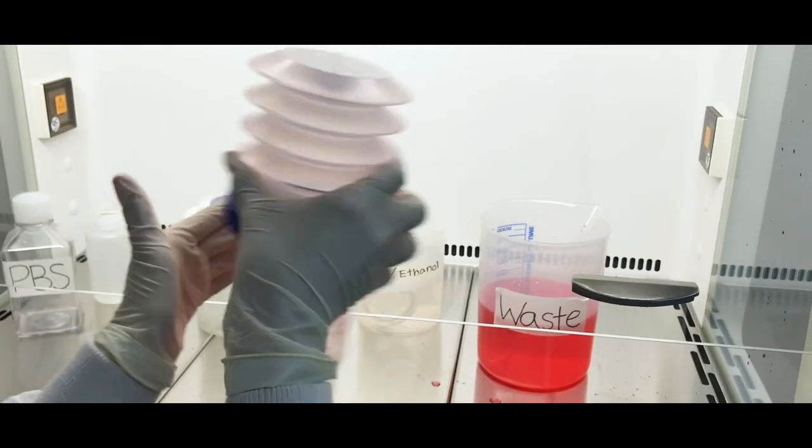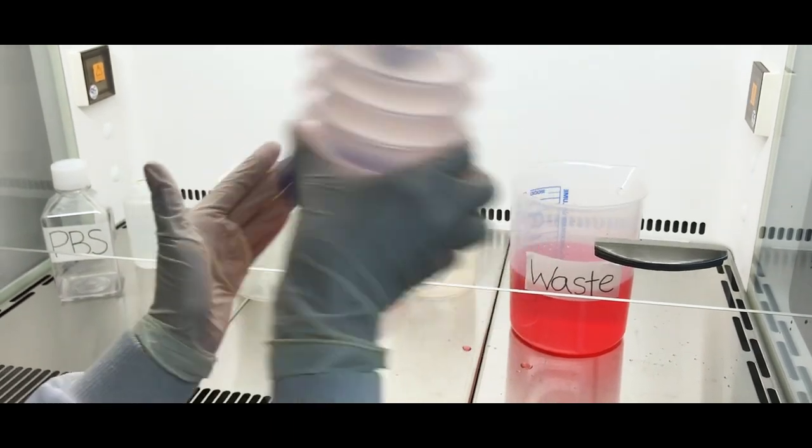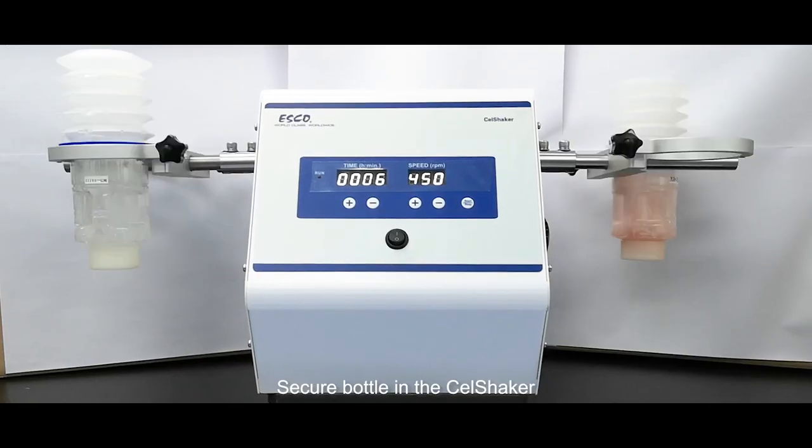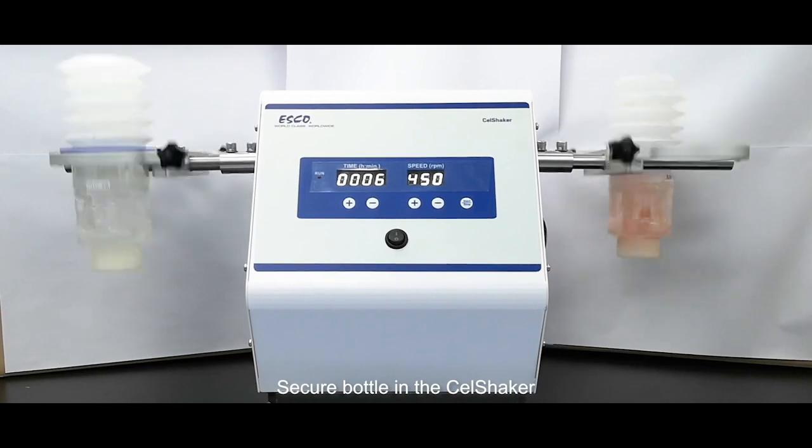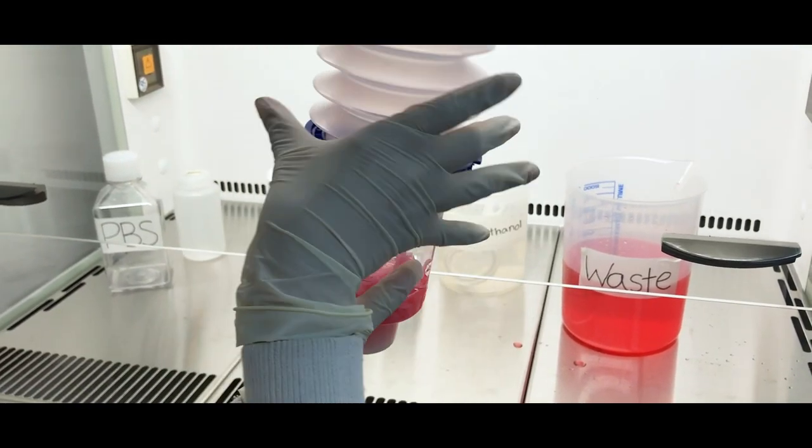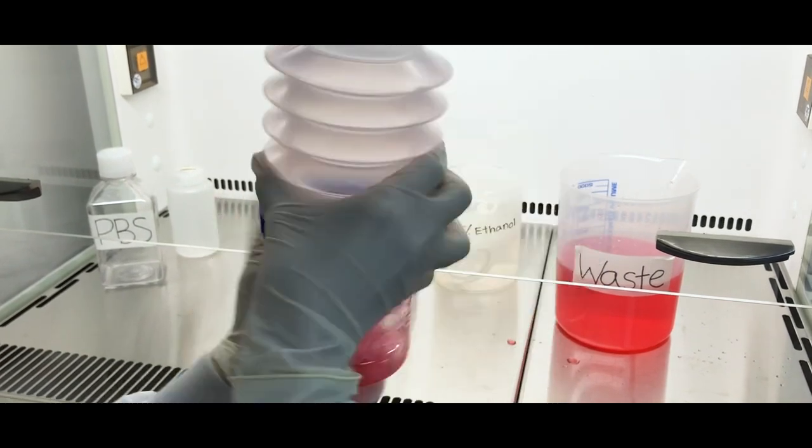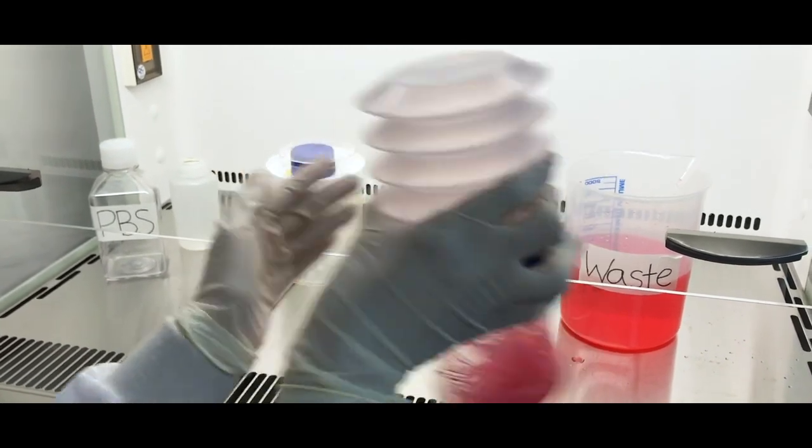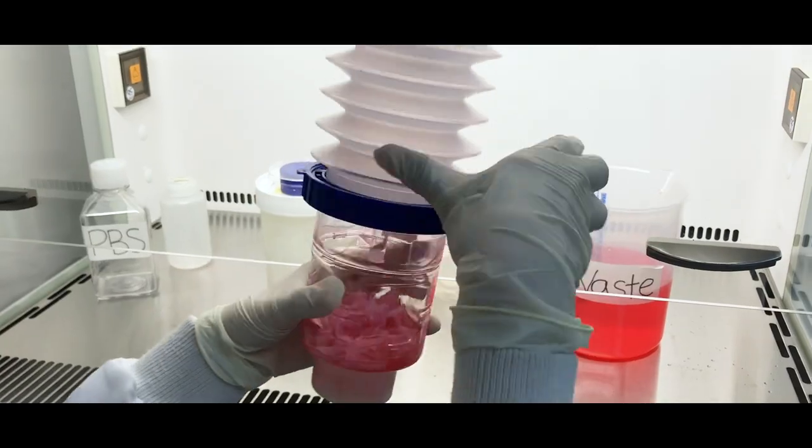Additionally, rotate the bottle and sharply tap each succeeding corner steadily. Alternatively, the cell shaker can be used for this agitation step. Do note that using a trypsin inhibitor is encouraged as serum will cause foaming, hence preventing cells from being dislodged during harvesting.